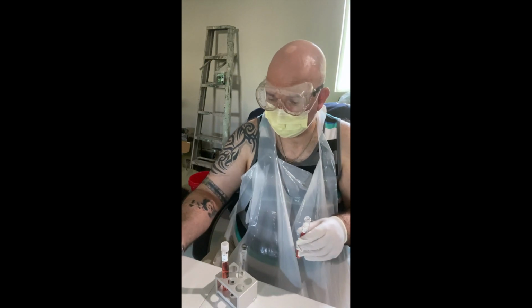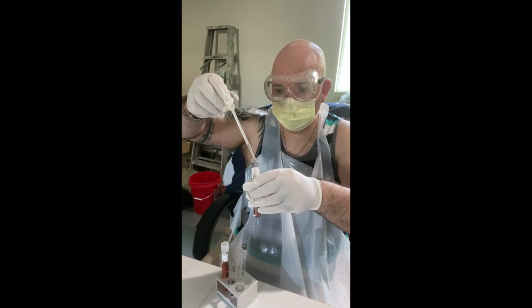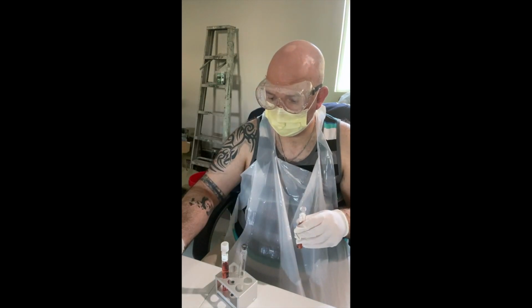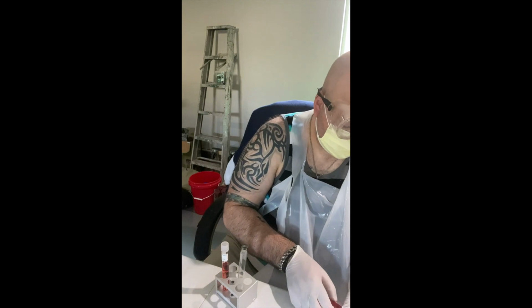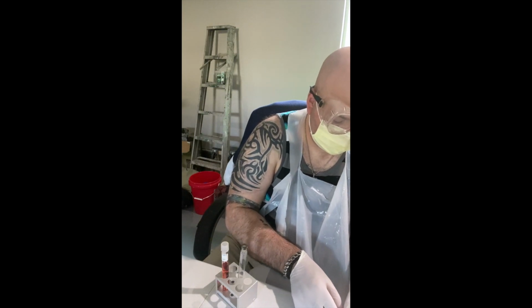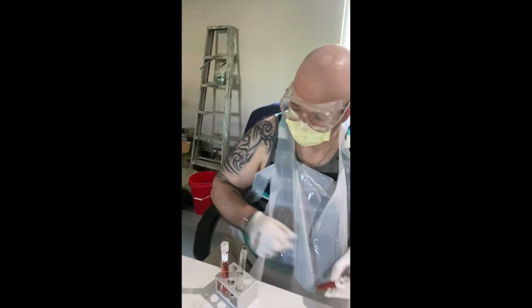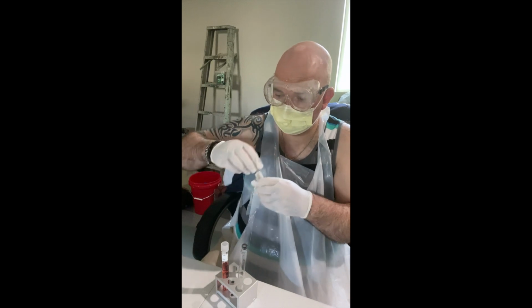Okay, and again, 4 drops. 1, 2, 3, and 4. Flame to sterilize. Alright, lid on and set aside.